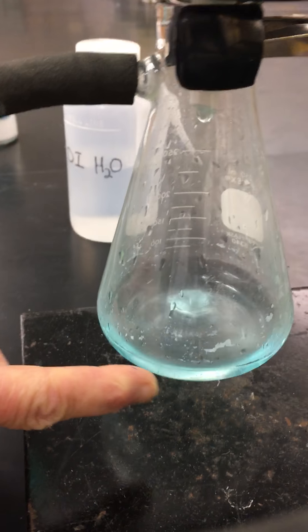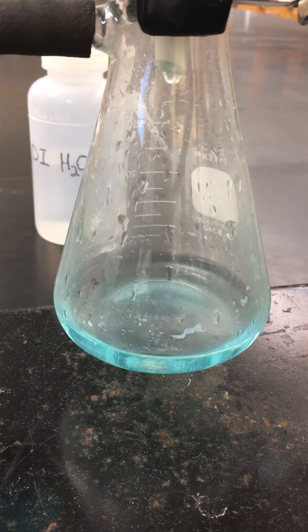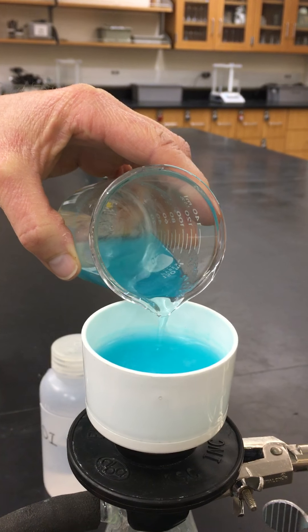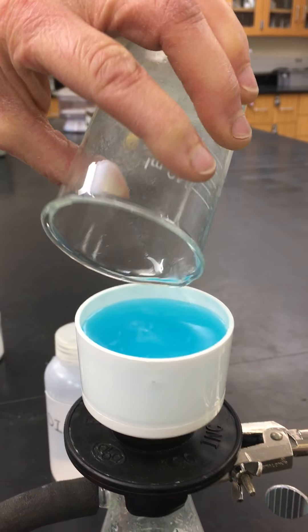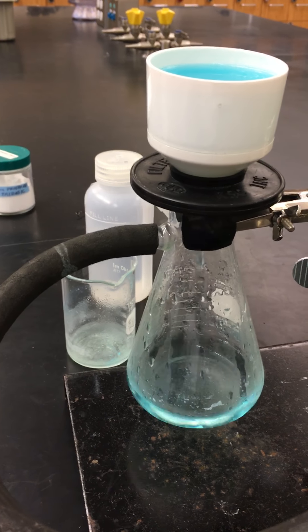If you look at the filtrate that's coming through, you can see it's a clear bluish color. We want to think about the color to help us determine what was our limiting reactant versus the one that we have in excess. We're going to let this pass through.